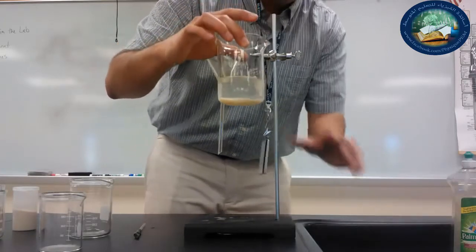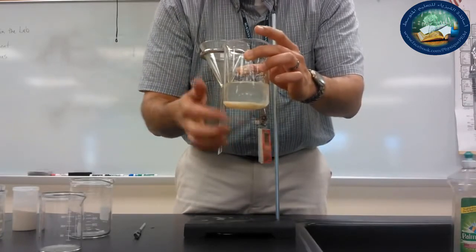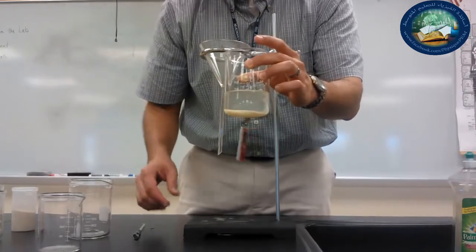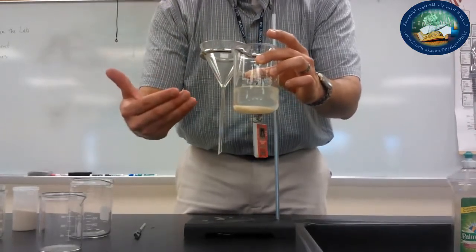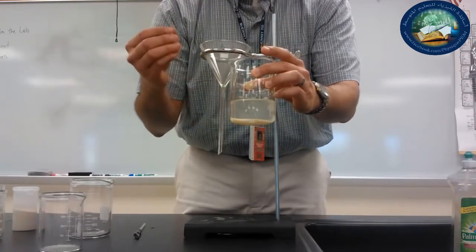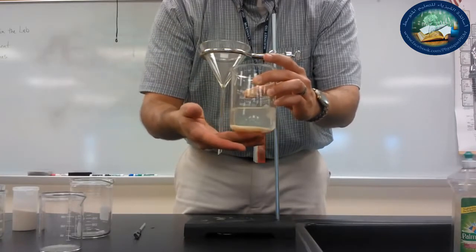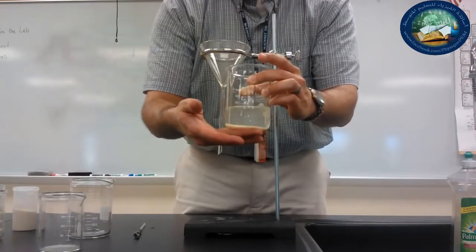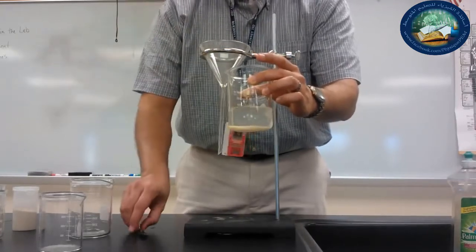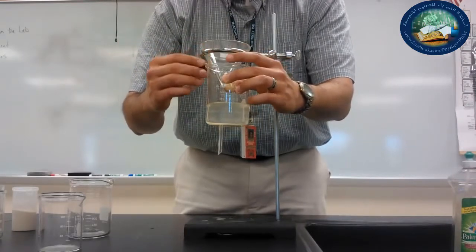So here we've allowed it to sit for a little while. You can see most of the sand is at the bottom of the beaker, and then the water is at the top. And when we've allowed this to happen, we can decant the liquid, right? So we're going to decant the liquid on top. Decant means to pour out carefully so that you leave the sediments on the bottom. So the sand that is on the bottom, I want to keep it there, and I'm going to pour it carefully into another container in order to begin separating them. And this is going to be a rough separation.